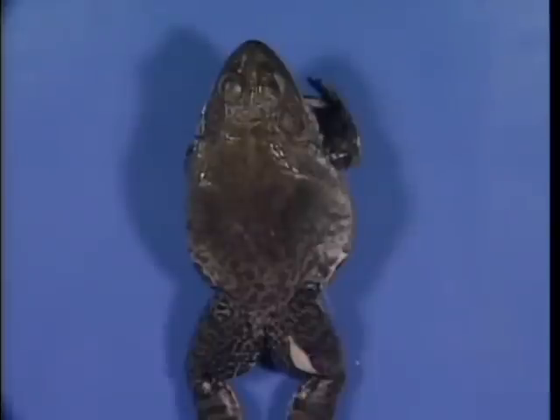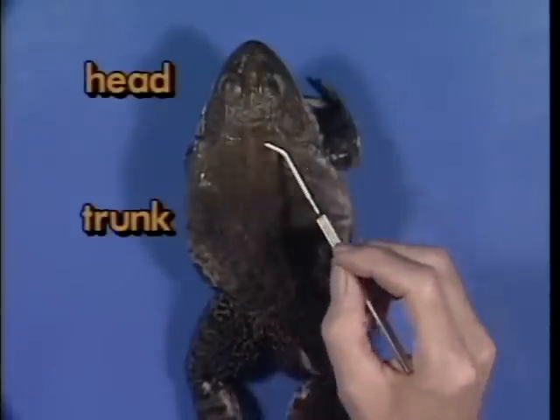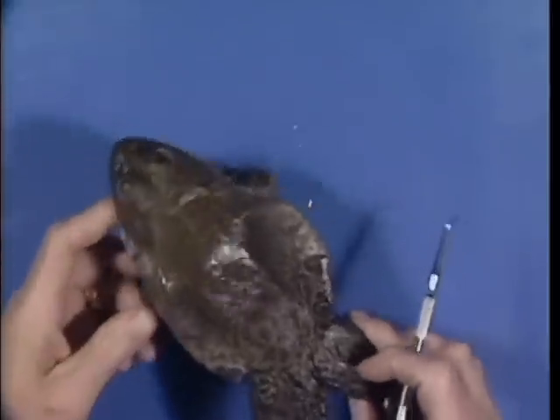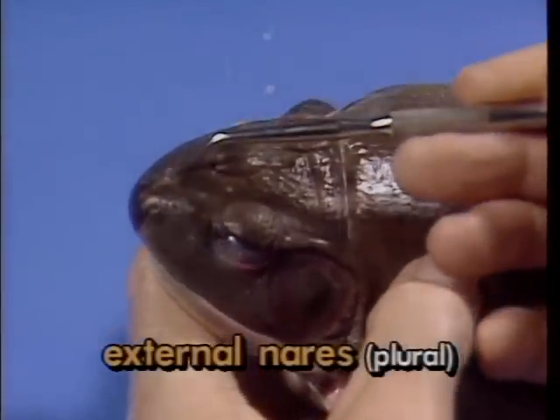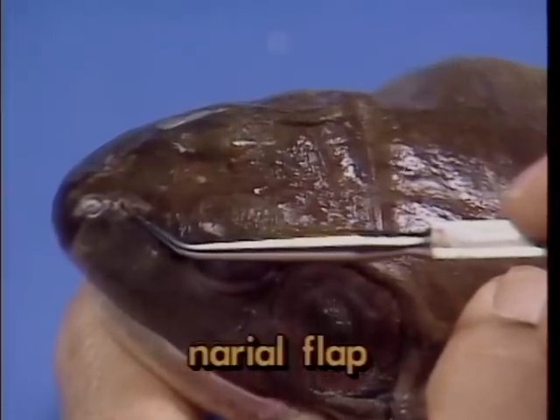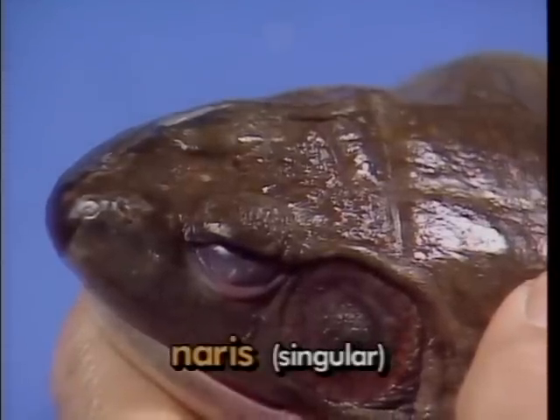First, let's take a look at the external features of the bullfrog. The body can be divided into 2 parts, the head and the trunk. Just posterior to the tip of the snout is a pair of small openings, here and here, called external nares. Each has a small cover of skin called the narial flap, which allows the frog to open or close the nares during the breathing cycle.